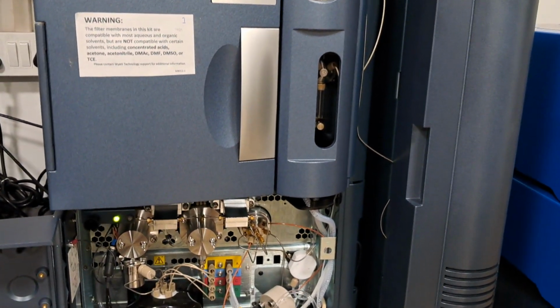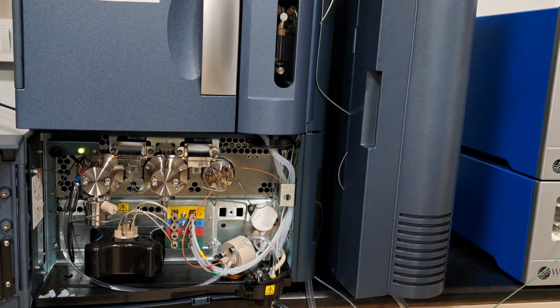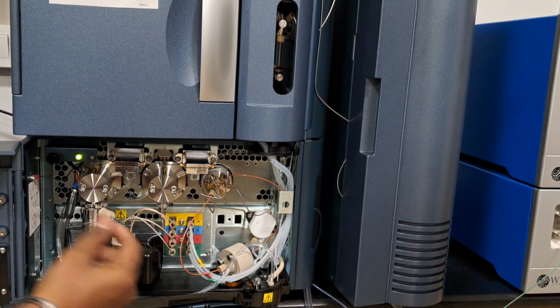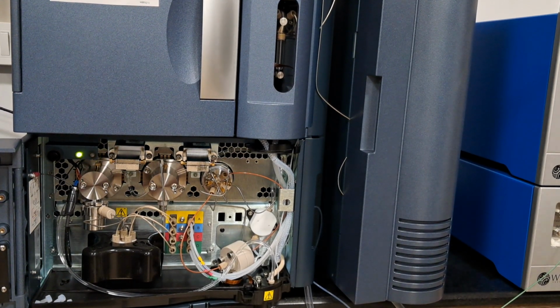So the volume of this solvent is prefixed, right? Yes. So what is the amount? It may take a maximum of 5 ml. It comes up as a drop actually. Maximum 5 ml it will take. No, that is fine. 5 to 10 ml it takes.